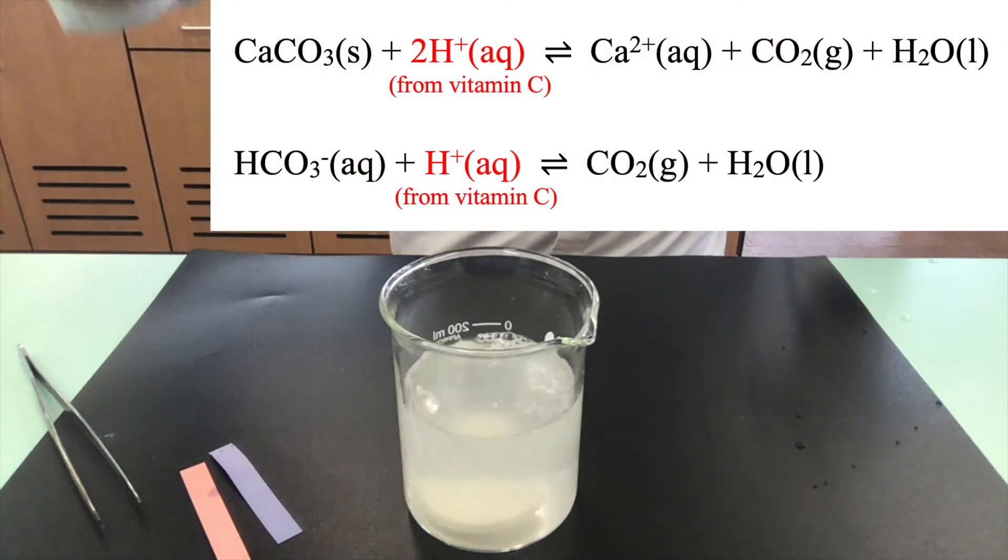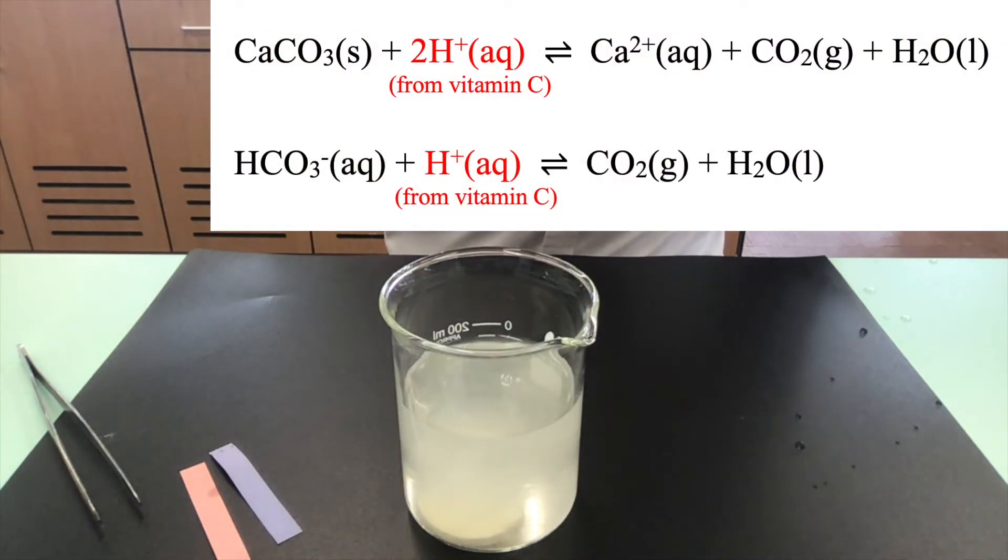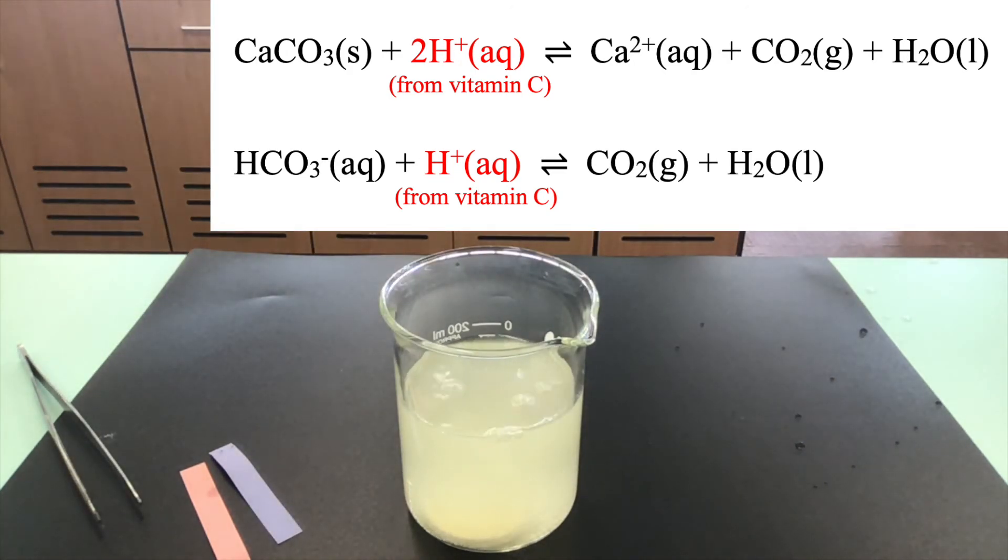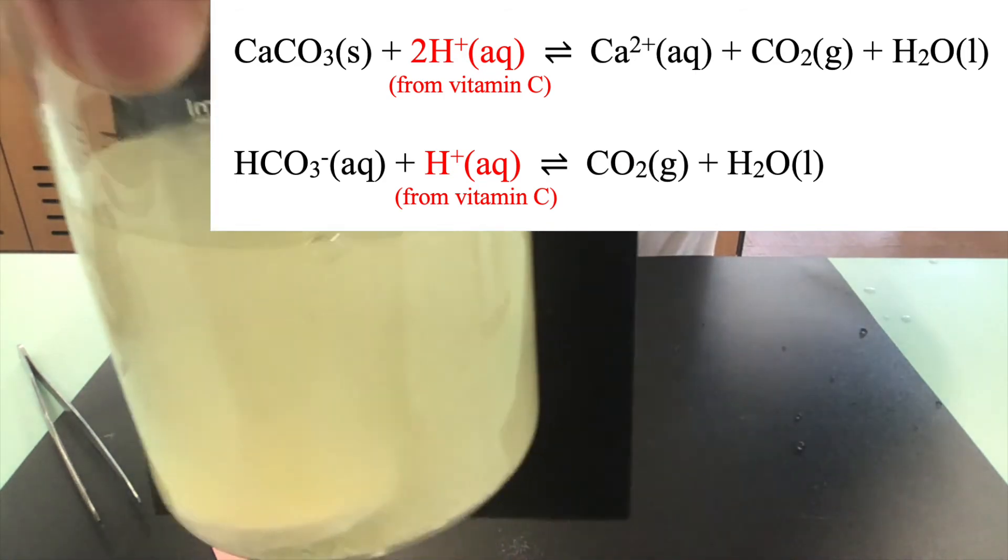When water is added, effervescence is observed. It shows that the vitamin C is reacting with both the carbonates and the hydrogen carbonate.